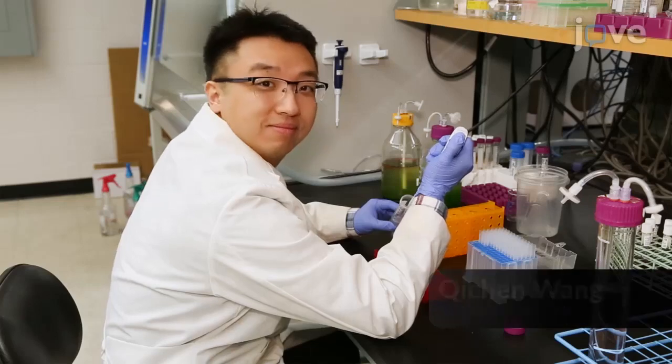Demonstrating the procedure will be Qichen Wang, a graduate student from my laboratory.